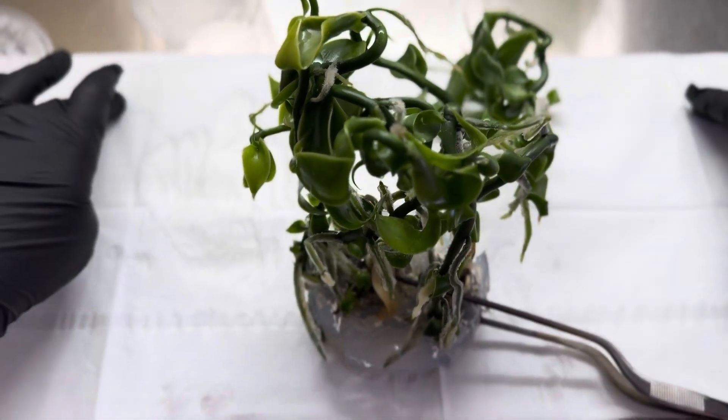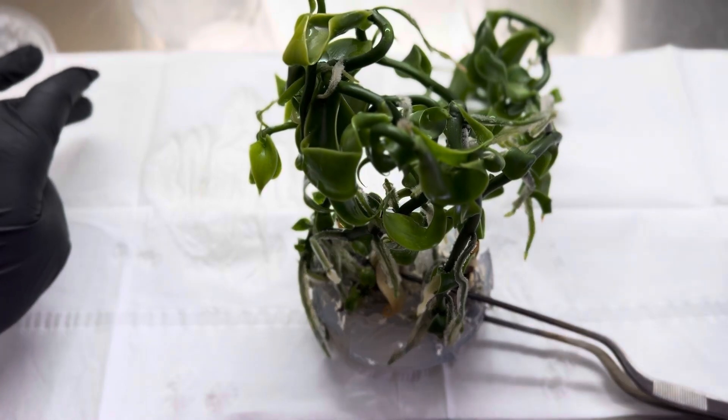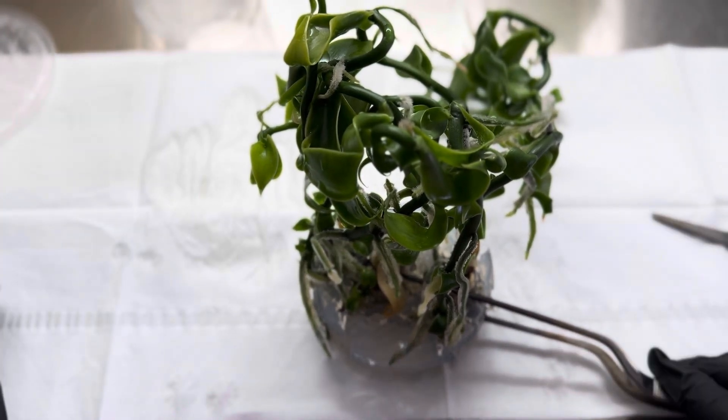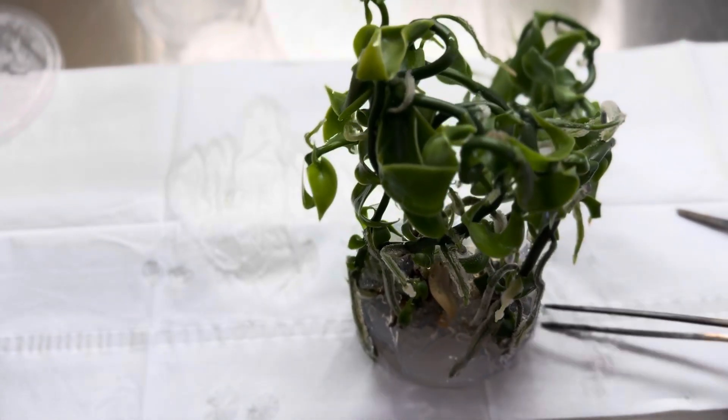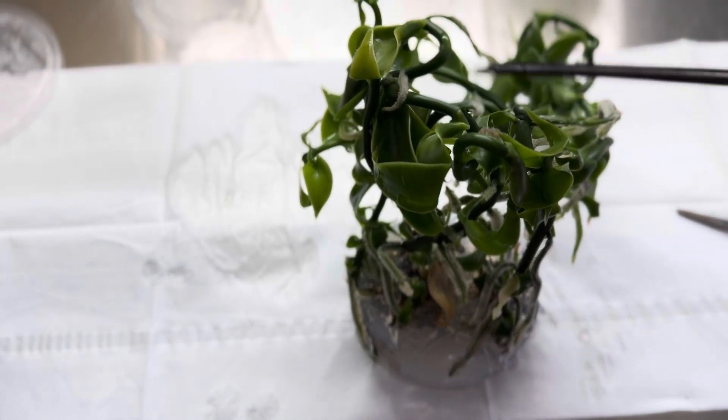So quite a healthy vanilla plant tissue culture. It's beautiful, ready to get broken down that's for sure. So many shoots.